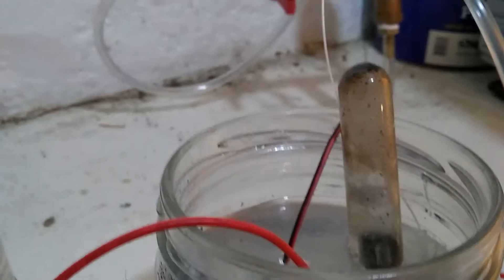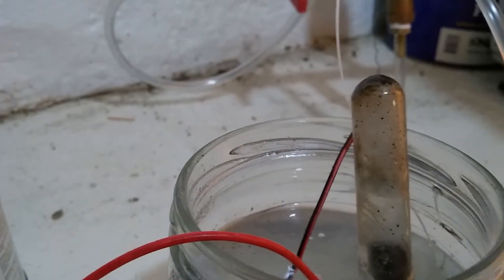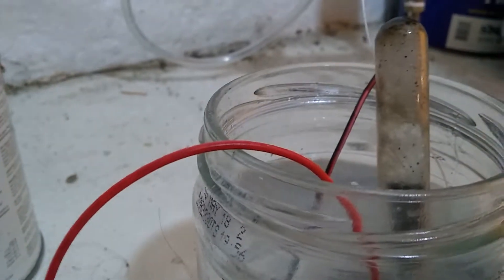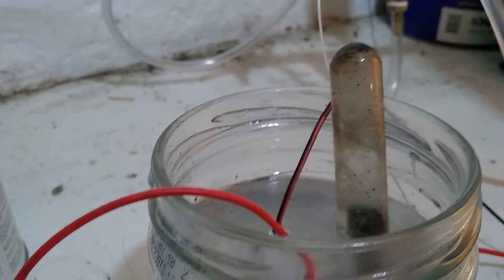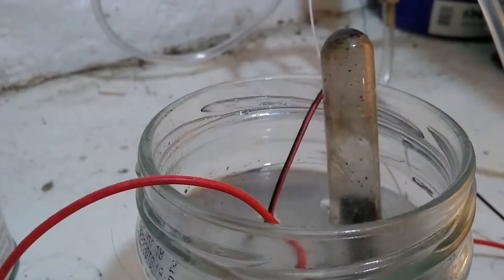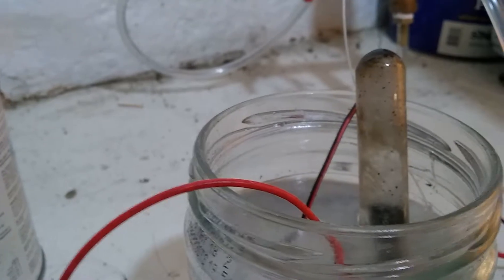Pulling up the solution in the test tube. And as the gas begins to generate, it'll begin flowing through the system. It'll start collecting in the test tube over here.